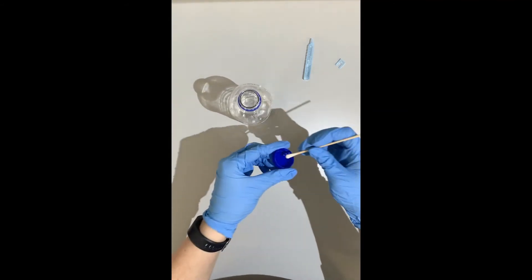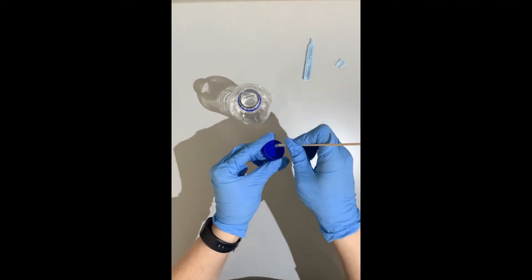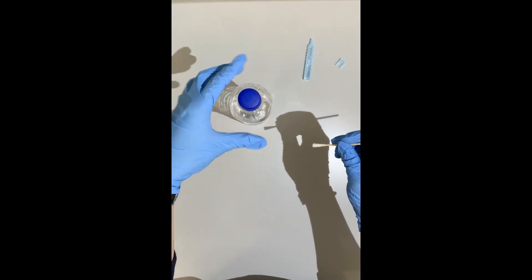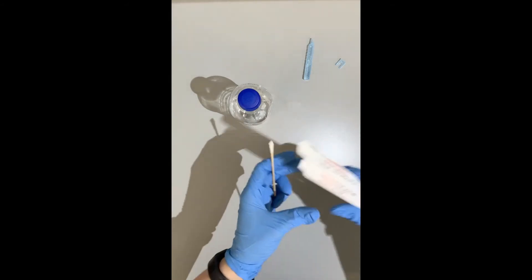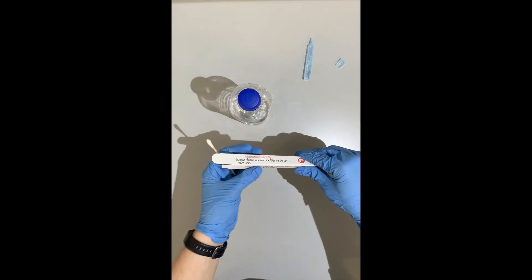You can also swab the inside of the cap because these items do touch each other. Then we'll need our swab carton.